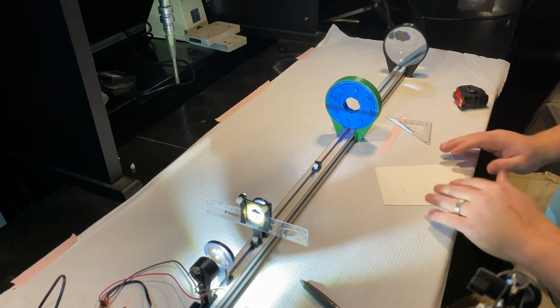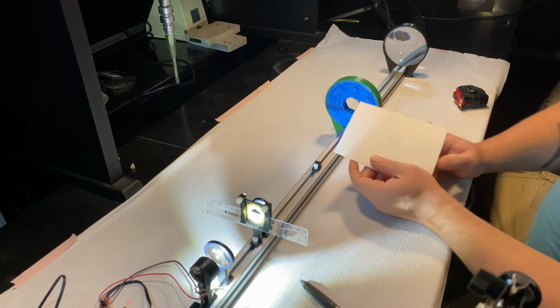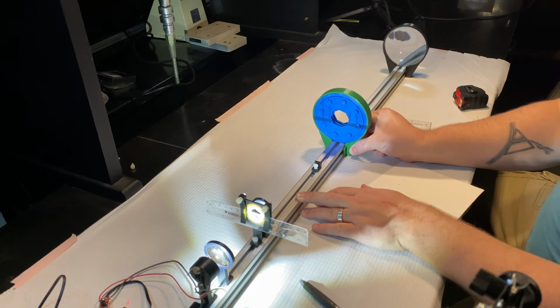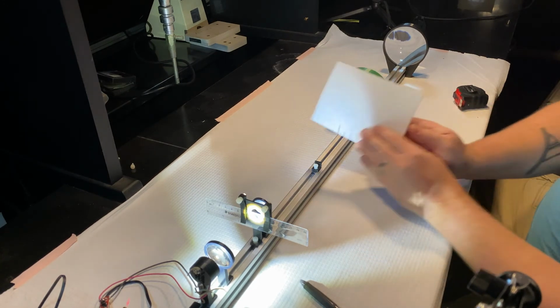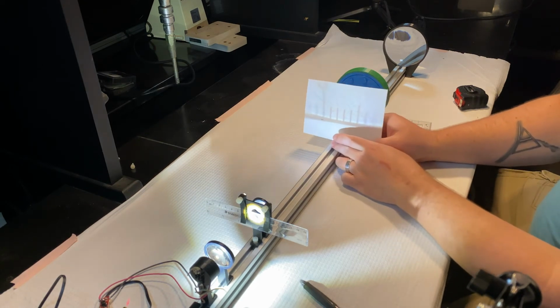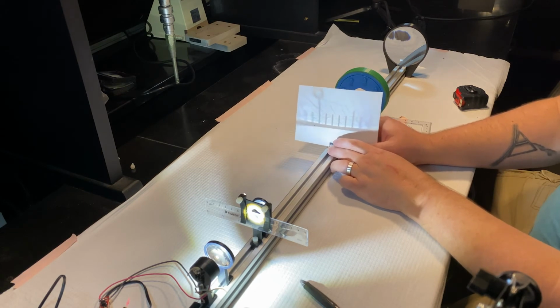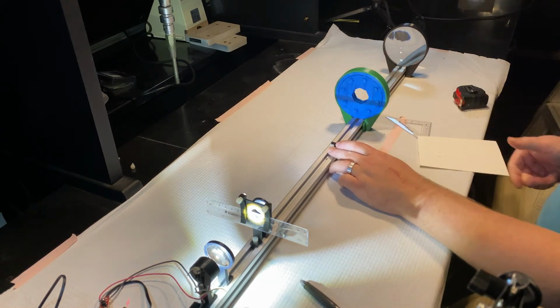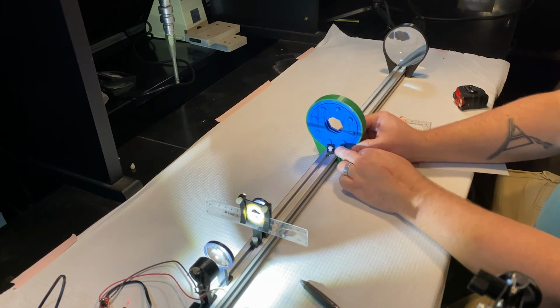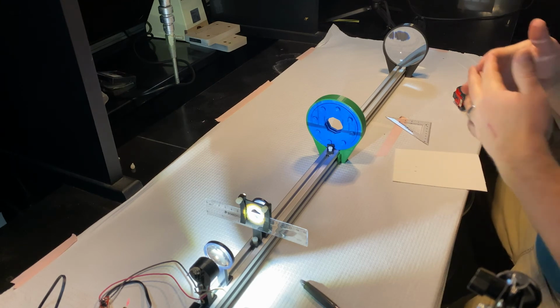All right, so we already know where the conjugate focal plane is. It's right about here. And I have this nice iris that I'm going to place right at where I think this focal plane is. So let me just spend a second figuring out where it focuses the best. It's right about there. I'm just going to hold my finger there, and we're going to move my iris right there. So I've moved my iris there. It is fully open right now.